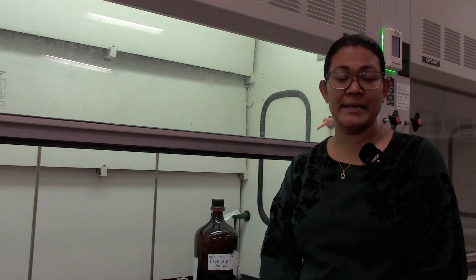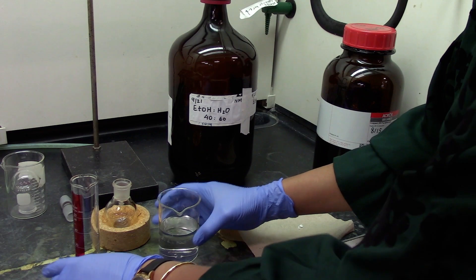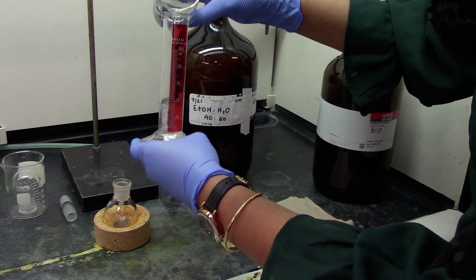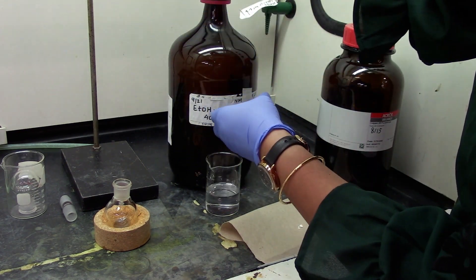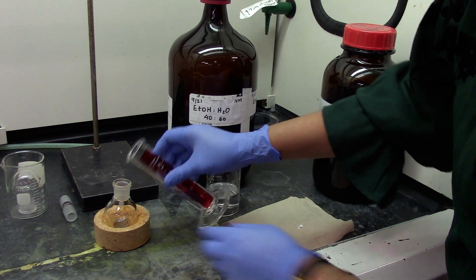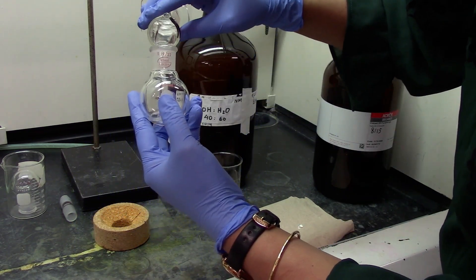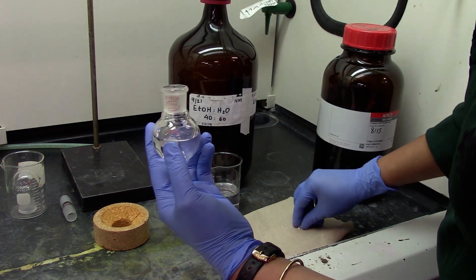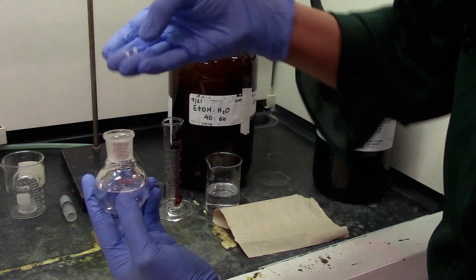Let's start by getting a 25 ml mixture into a 50 ml round bottom flask. Here is my mixture — let's transfer 25 ml and then transfer to a 50 ml round bottom flask, which is the distillation flask. Remember to put two boiling stones.